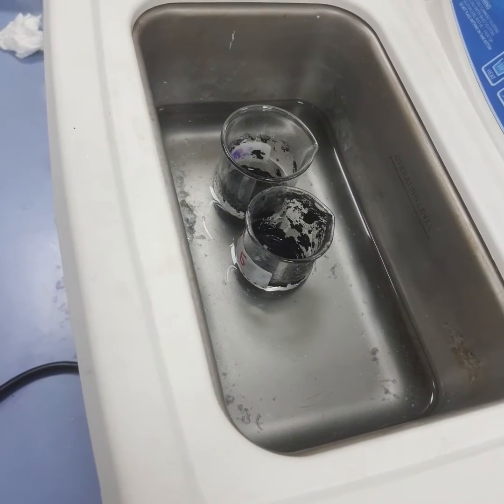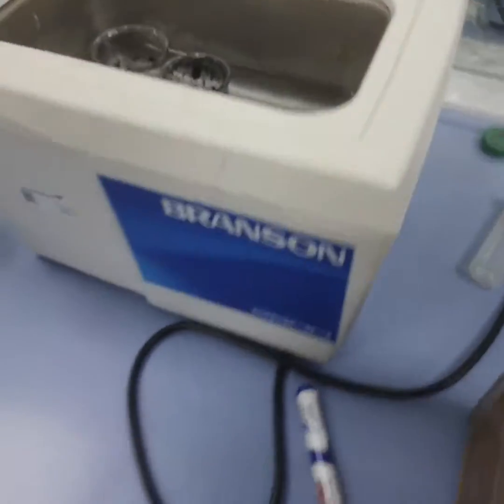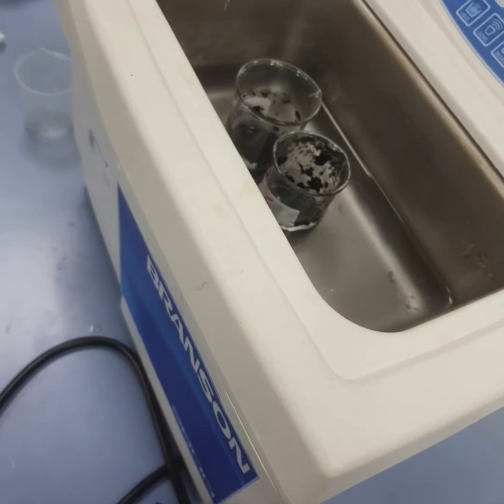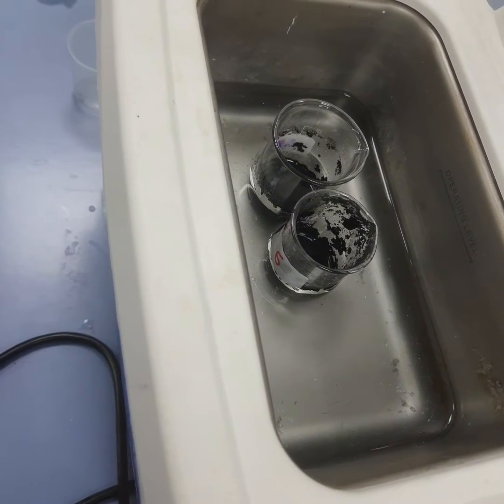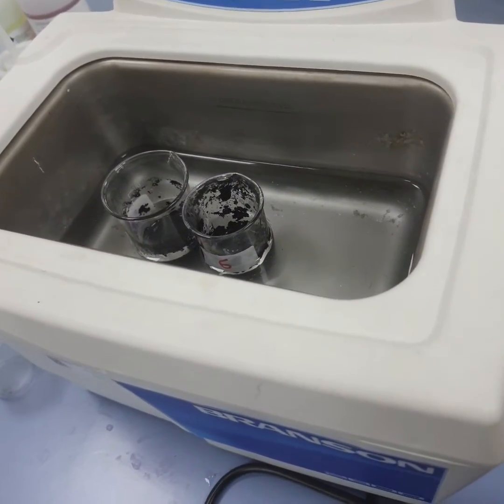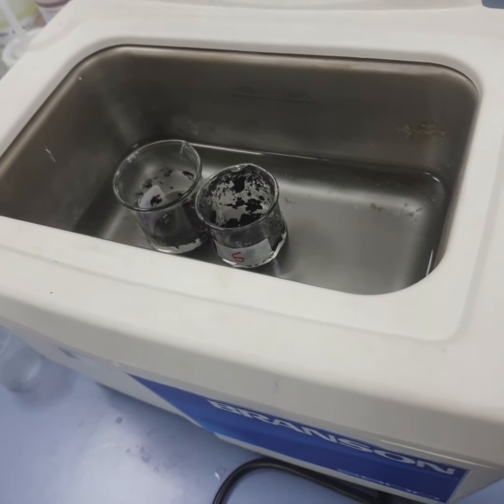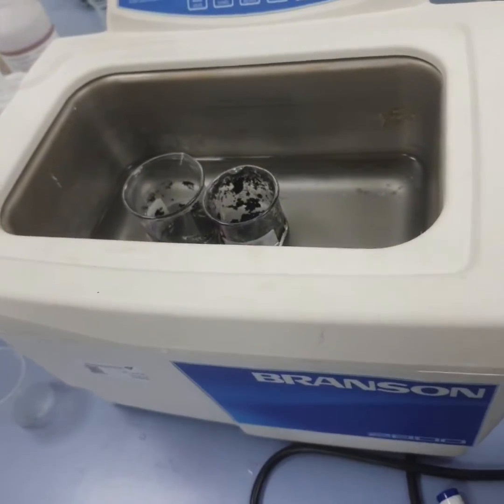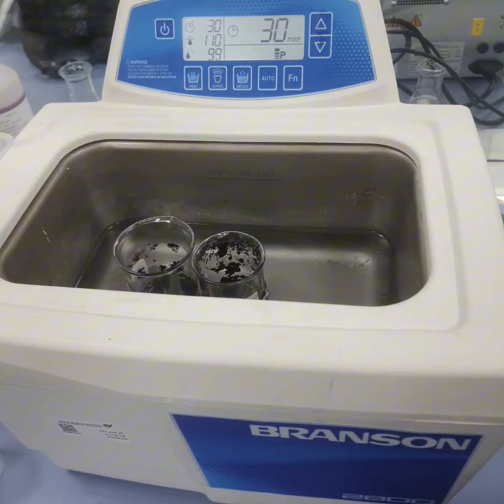First of all, we measured a certain composition of DMF in each beaker, and we made it equal in all the samples. Then we measured the PCL, the polymer. The composition of the polymer is different in all samples, which will give us a different result during the preparation of the membrane later. Then we measured the activated carbon and made it in a certain composition with the CNF, because every time we try a different composition, it will give us a different result. In each sample, we increased the percentage of the biochar, and so we also increase the percentage of the CNF, and this will affect the quality of the membrane during fabrication.